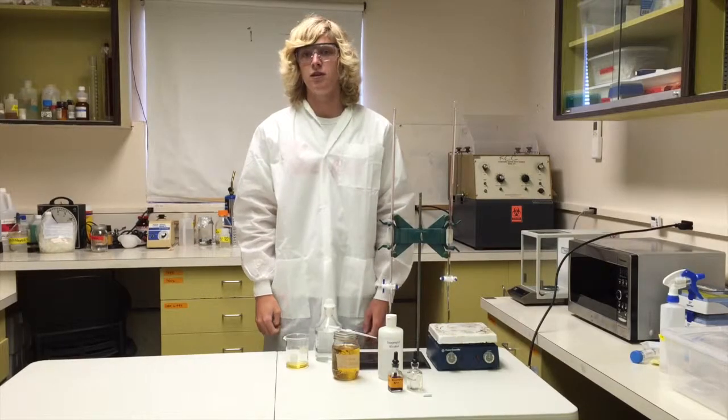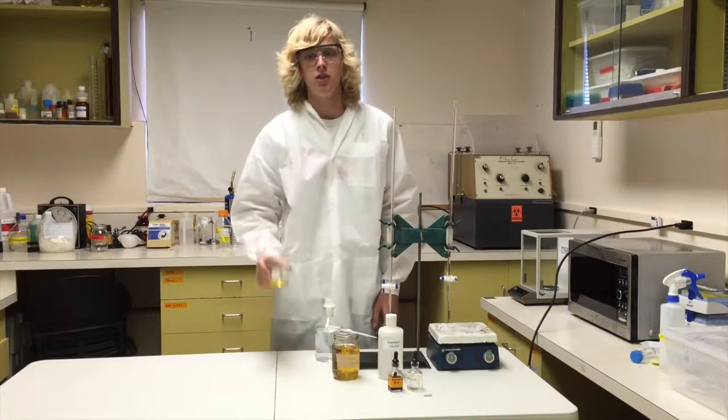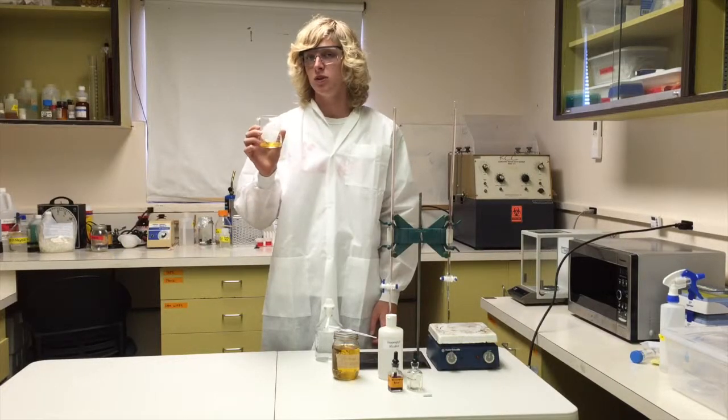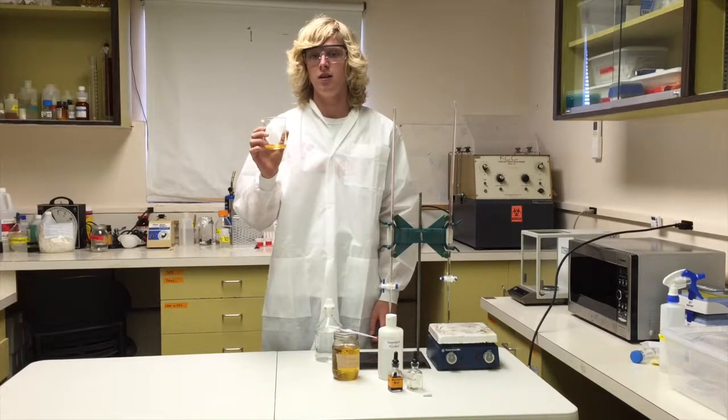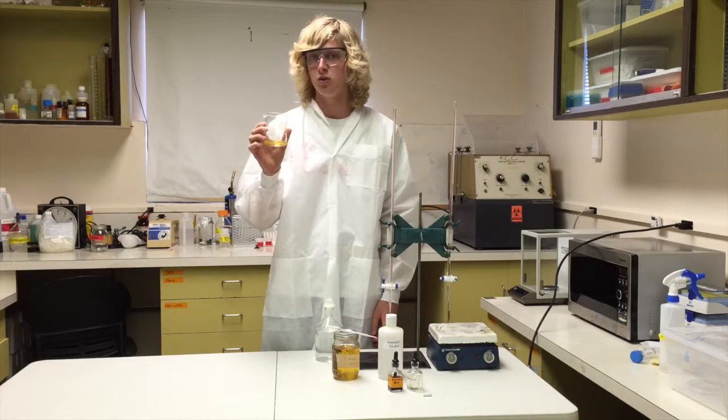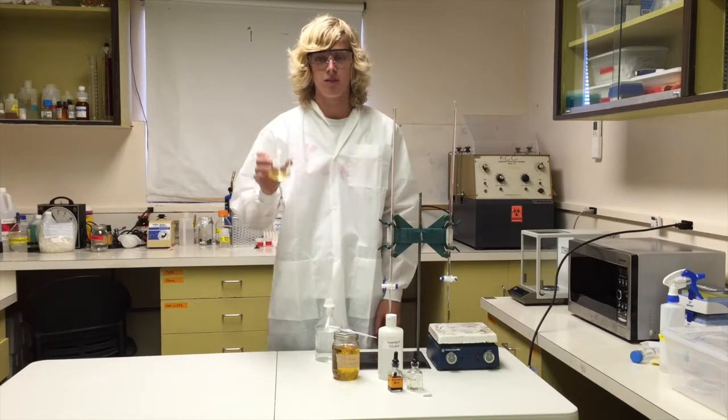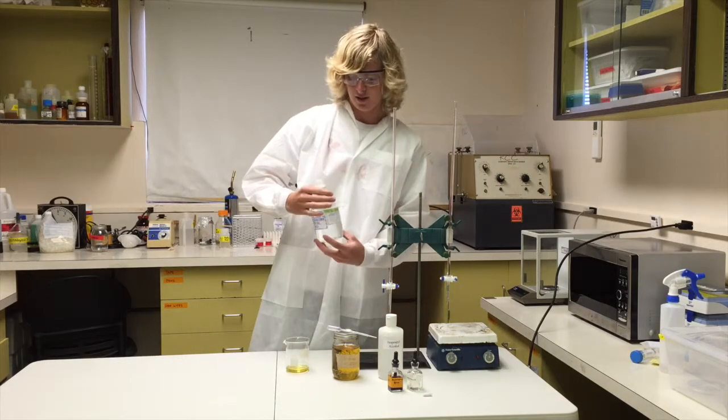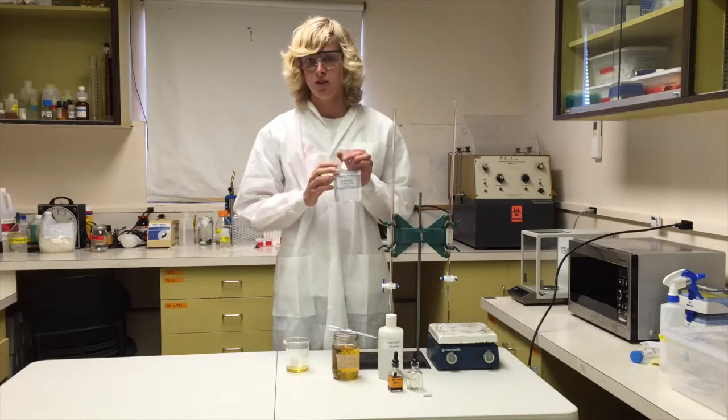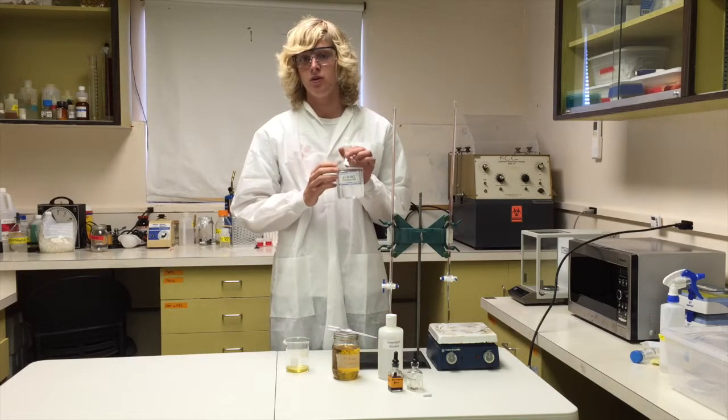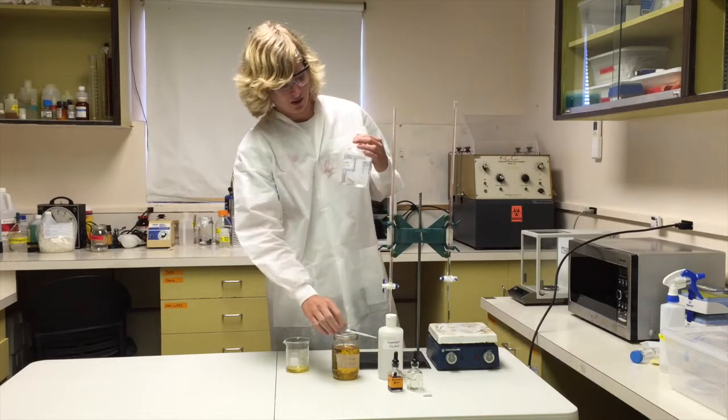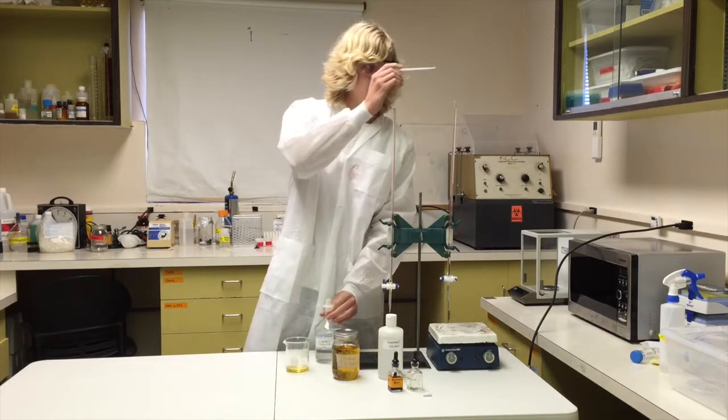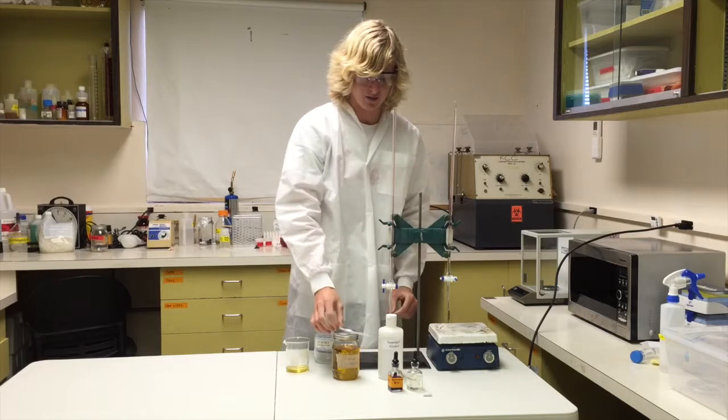For the soap test, the first step you're going to do is measure out 20 grams of washed biodiesel, or 10 grams of unwashed. In our case, this is 20 grams because it has been washed. After that, you're going to take 10 milliliters of 0.01 hydrochloric acid, and you're going to fill up the burette, which we have already done over here.